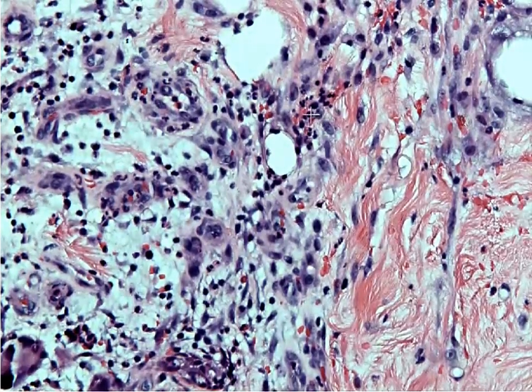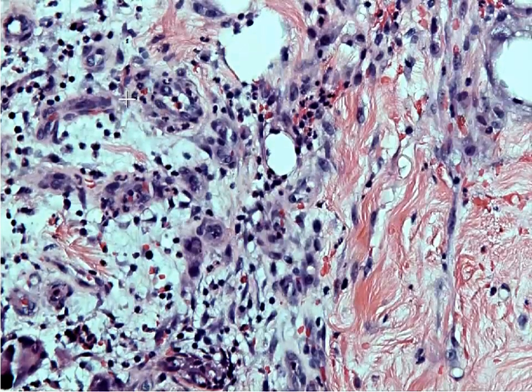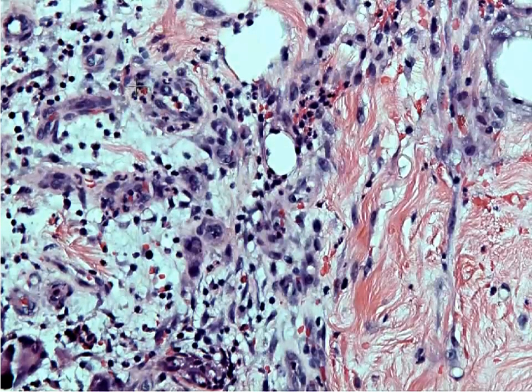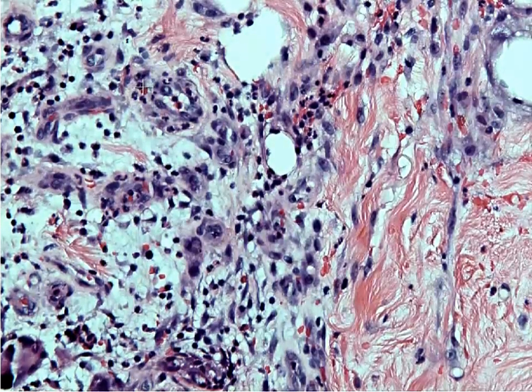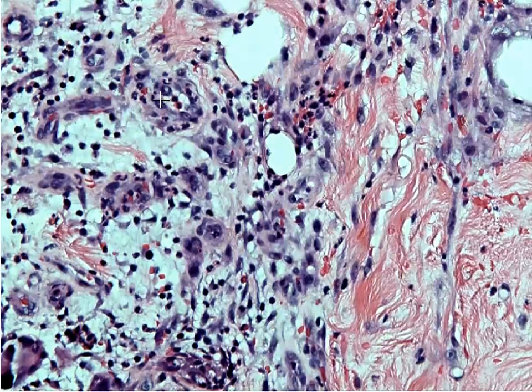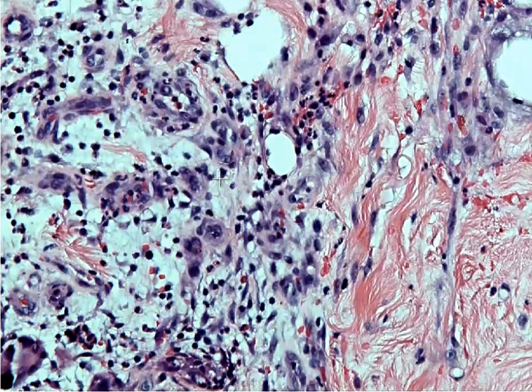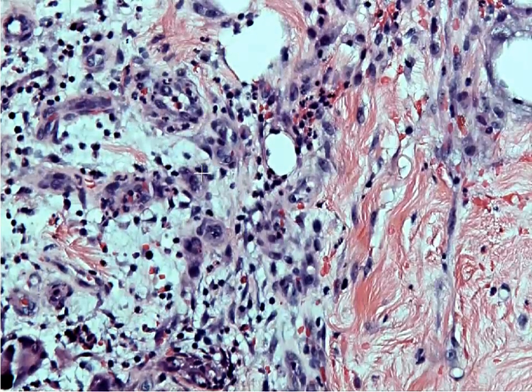One of the most common cells that we see are going to be neutrophils. You can tell a neutrophil because it has kind of pink cytoplasm and irregular lobated nuclei.